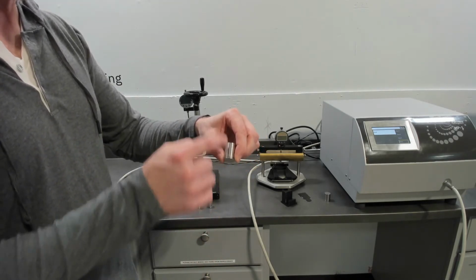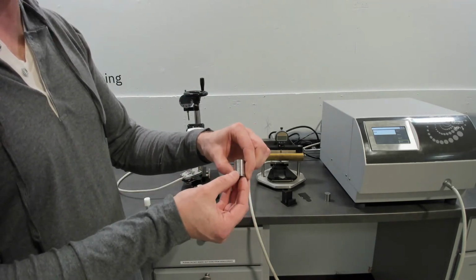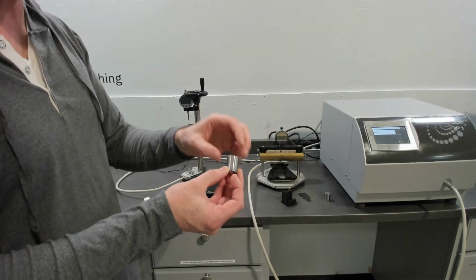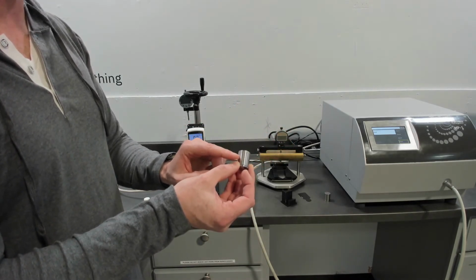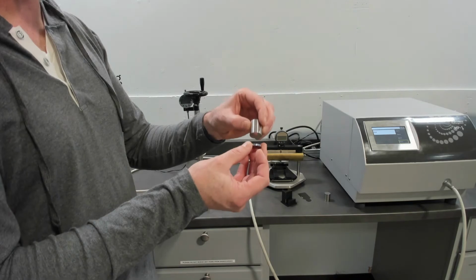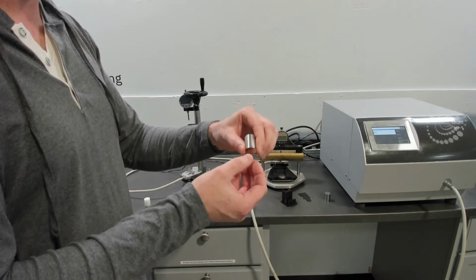Both of these, piece A and piece B, are treated as part of a series of resistances that we're measuring into, and there are quality indicators. Piece B is treated as an unknown, so when you're measuring your data, you can verify that you have a good, sound experiment by achieving acceptable data of specific heat on piece B. So measuring through piece A, through a contact resistance or introduced material, and into piece B, there are lots of ways of determining that you have a good set of data.